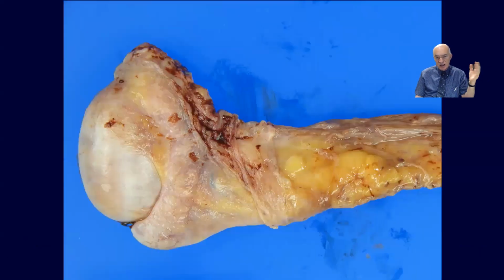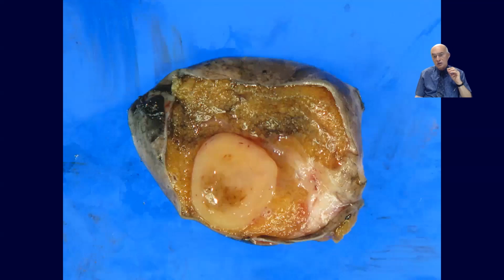This is an external appearance of a radical orchiectomy with the testicle and then the epididymis and then the spermatic cord, that has to be also very well studied and sectioned. Here is the section of the testicular parenchyma with a very interesting tumor that has this kind of very homogeneous and light yellowish, white yellowish appearance, that looks like fish meat. And then this is the typical description for the seminomas, for example, that has a very homogeneous appearance, probably with a central necrosis, and is very well circumscribed, as you can see here.